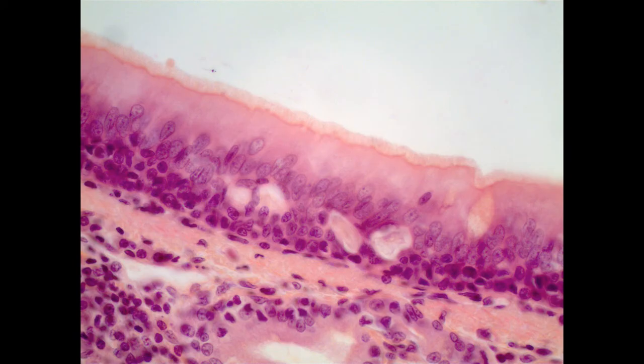And when there are multiple layers of cells, we call this stratified. But the truth is there's only a single layer of cells. It just so happens that the nuclei, because of this inconsistent pattern, appear to exhibit stratified, but in fact they aren't. And so that's why the name pseudostratified is given here. These are falsely stratified.